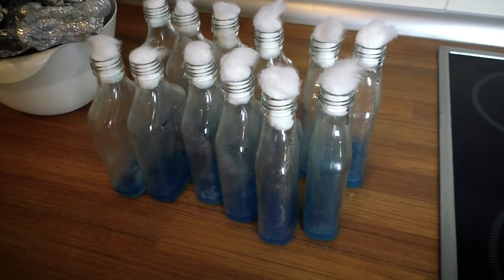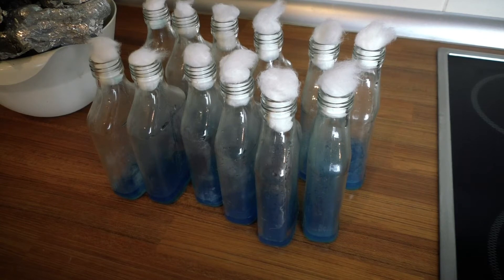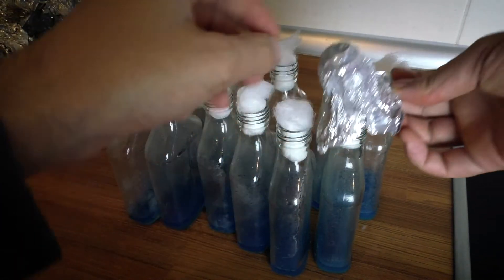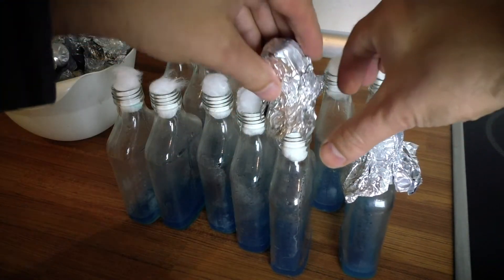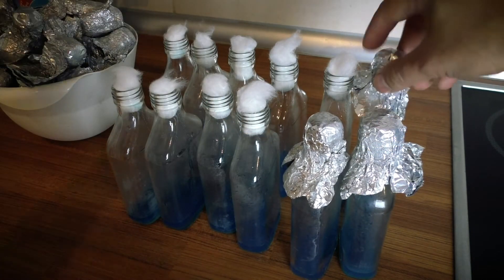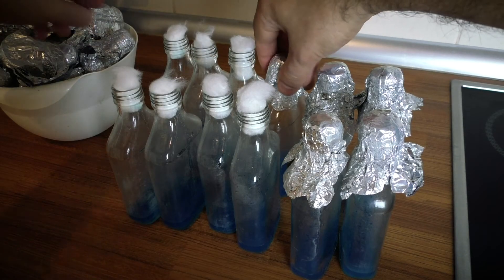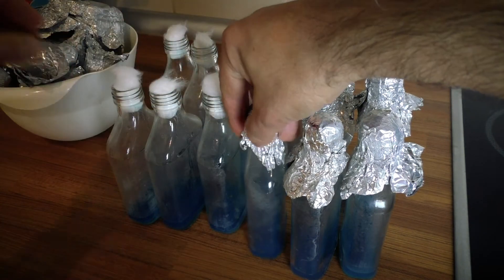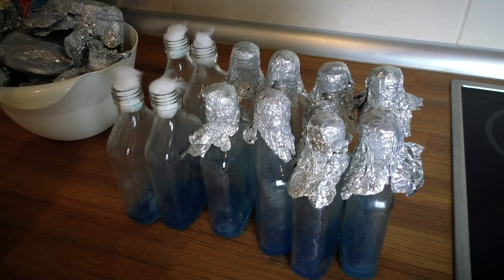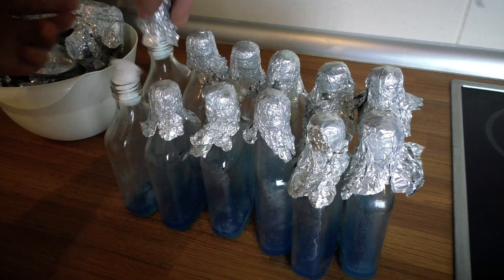These are the filled bottles and I've just stuffed a piece of cotton wool in the top of each one. Cotton wool is something that can go straight onto your compost heap or into your biorecycling. So the nice thing about this technique is the only kind of waste product that you make is organic and compostable. Here I'm just covering the tops of the bottles with some foil — this is to keep the steam in the pressure cooker from diluting the agar mix. I just keep the old foil pieces as they're easy enough to reuse.